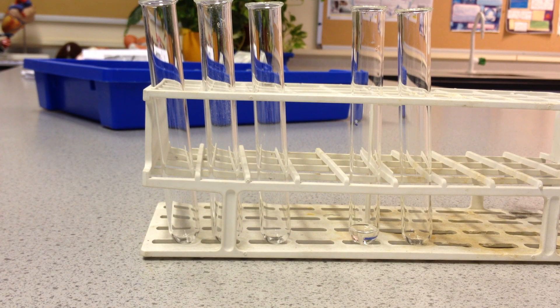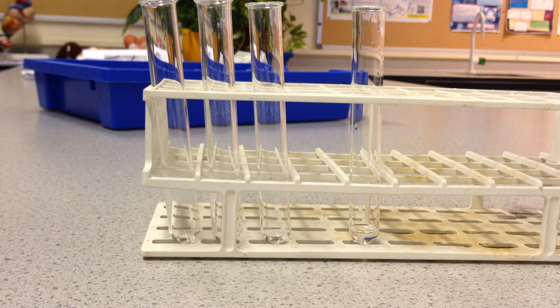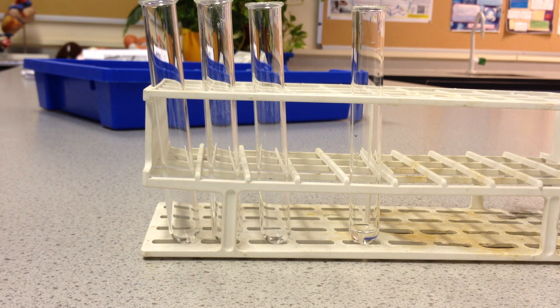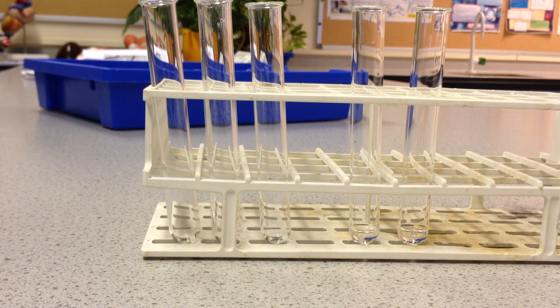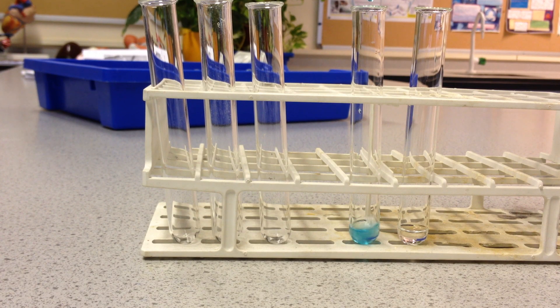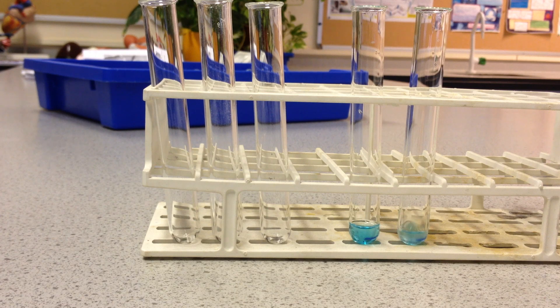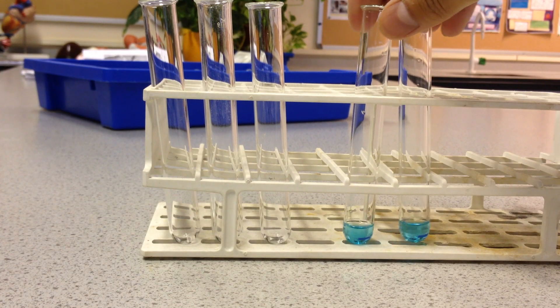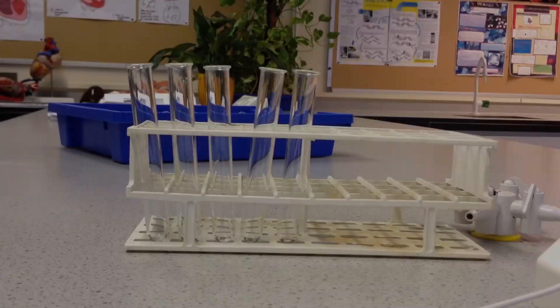And in the other I will add some water. To both I will add the same volume of Benedict's reagent. We will now put this in the water bath at around 80 degrees Celsius for about five minutes.